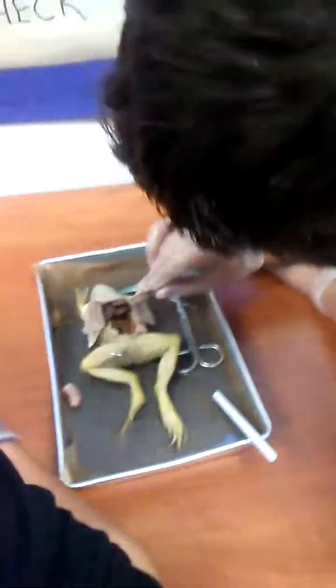Okay, there we go. What else are we looking for? Snip, don't pull. Got it, Mr. Cleese. Let's go for the brain. We are going to go for the brain. Okay, let's play.